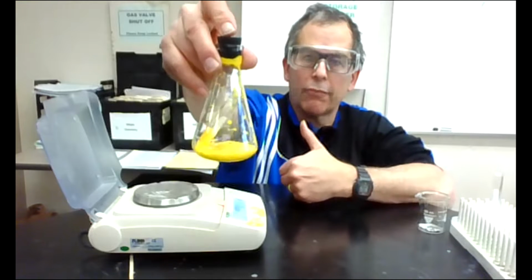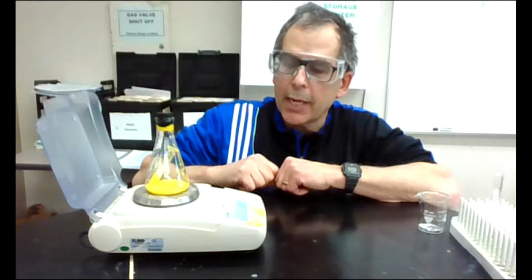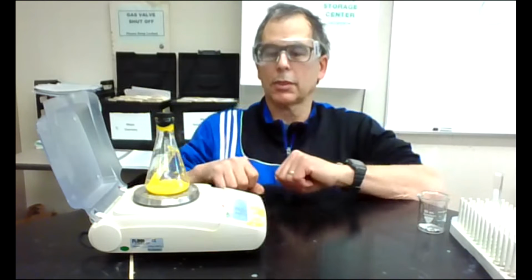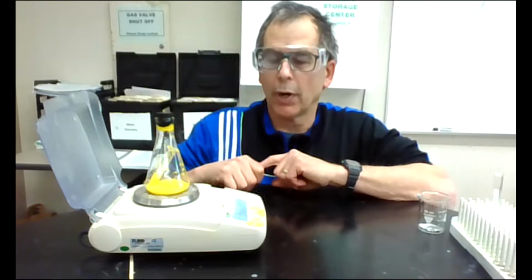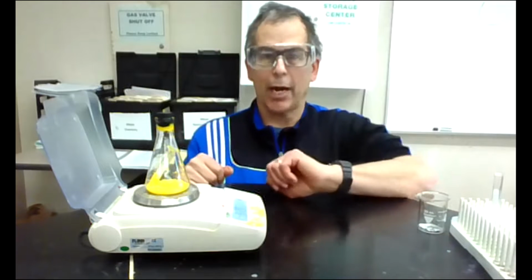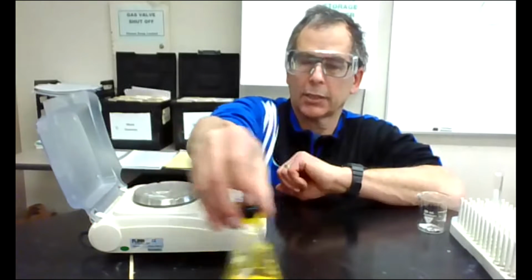I don't know if you can see that from there, but I'm going to weigh it again. And 97.93, I think it looks like it is the same as before. Both times it was hovering between 97.93 and 97.94, just because of air in the room, not because of an error with what we call conservation of mass.